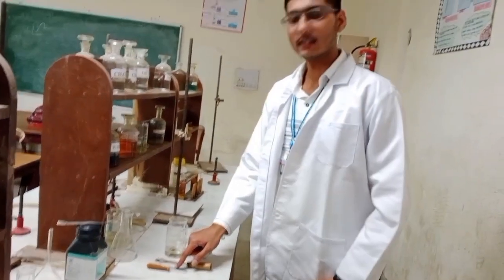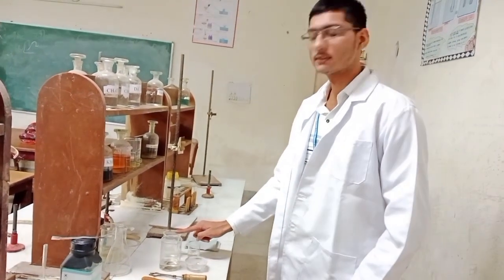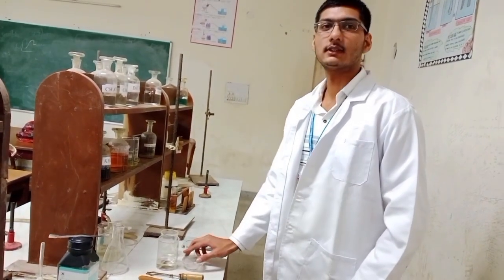Our aim is to analyze the given mixture of acid and basic radical. Apparatus and chemicals: dropper, spatula, test tube holder, dilute H2SO4, concentrated H2SO4, HCl and the given salt.